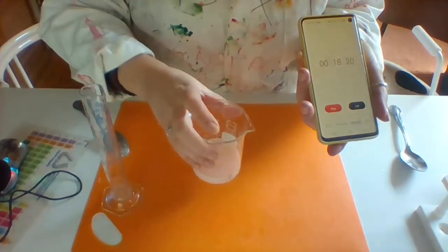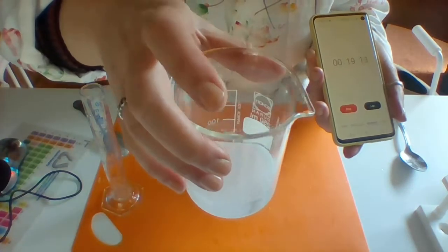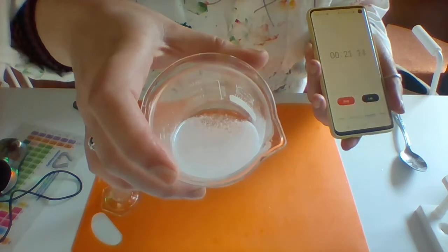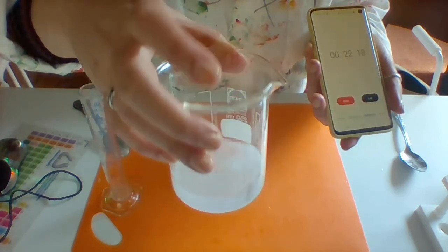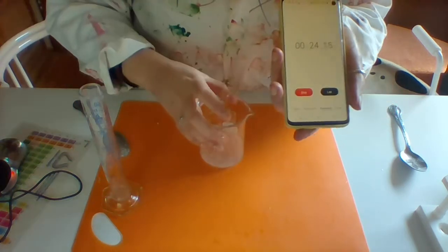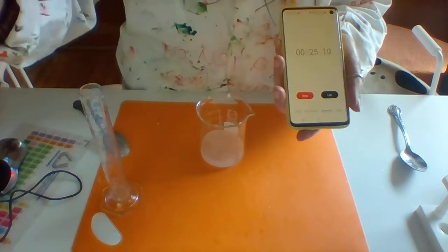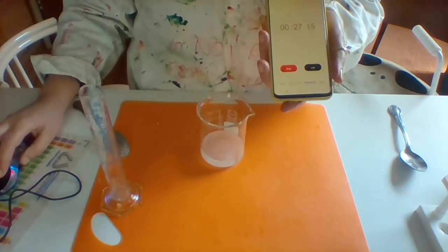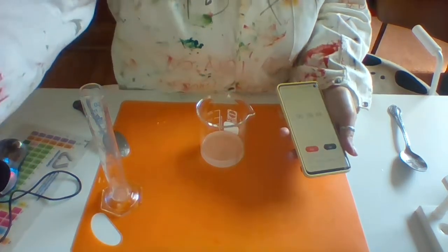I don't know if you can see that. And that is the surface area test.